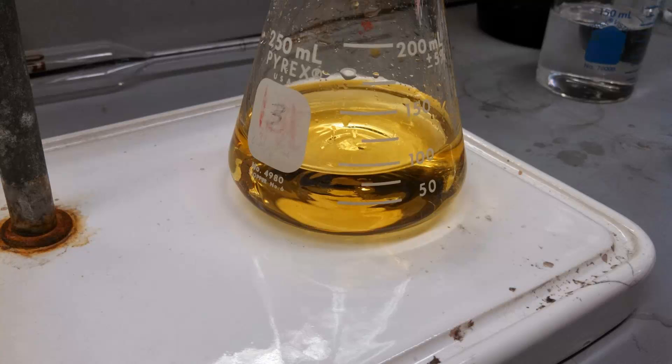You need to be really careful, though, not to wait for it to become too faint, because once the yellow color is gone, the triiodide is gone, and the starch won't do anything. The starch is acting sort of like a magnifying glass for our endpoint, just helping us notice a smaller change in I3- concentration.